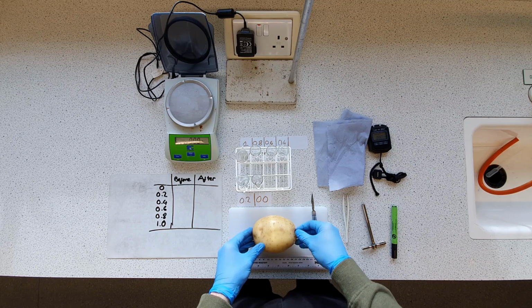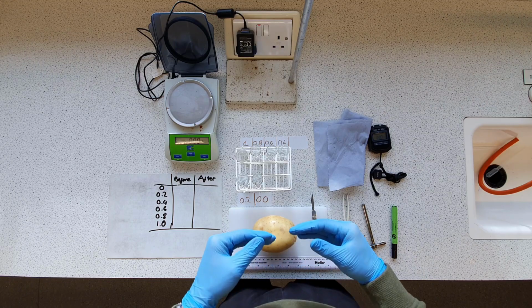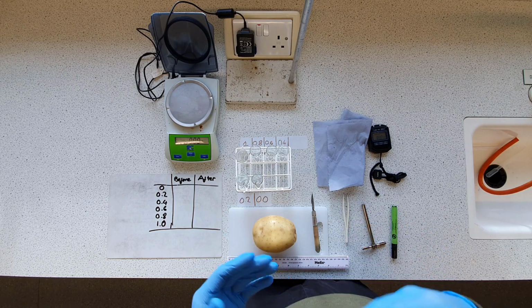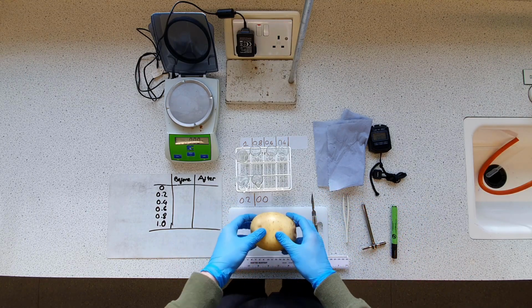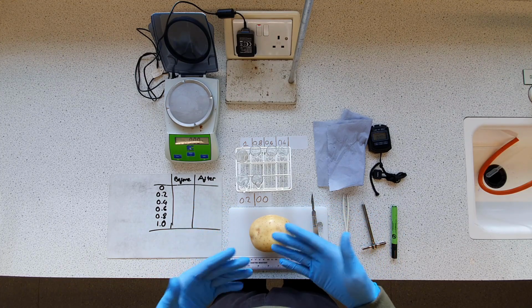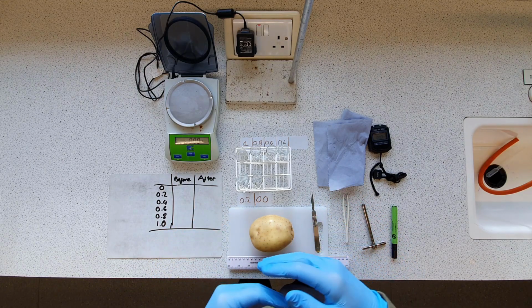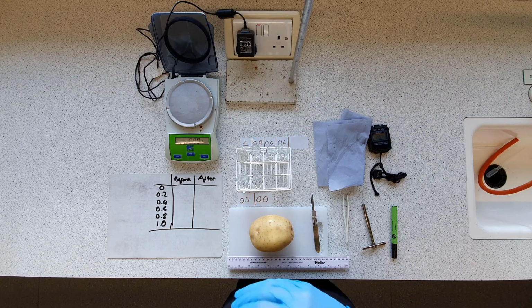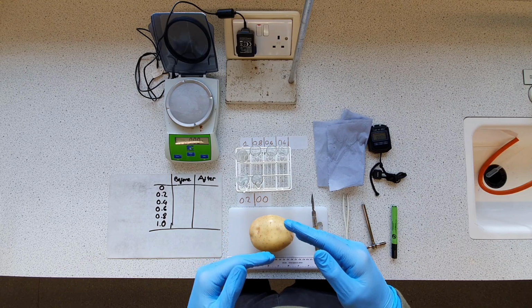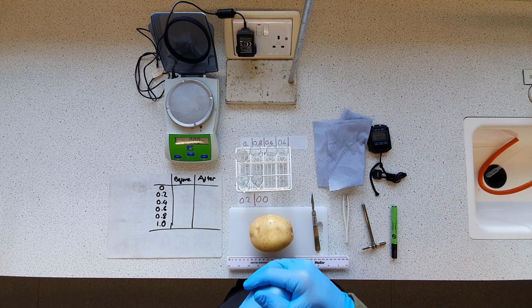And then hopefully that will correspond quite linearly to an amount of water that either left or entered the potato core. And from that we can work out a percentage change in mass, because obviously even if we're very good about making our potato cores the same length, mass isn't always going to be identical. So we're going to do up some percentages, put it into a graph, and hopefully we should be able to find a water potential at which the water concentration on the inside of the cells is identical to the surroundings, and that's what we call the isotonic point.